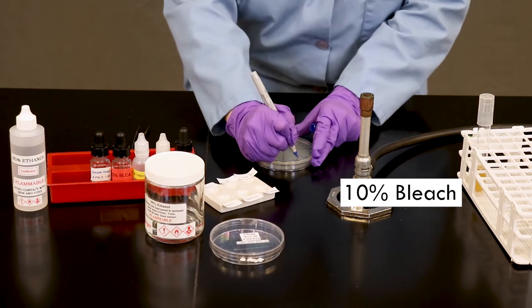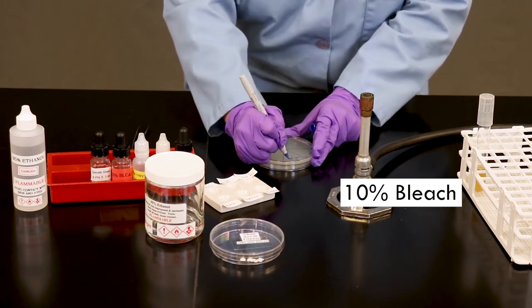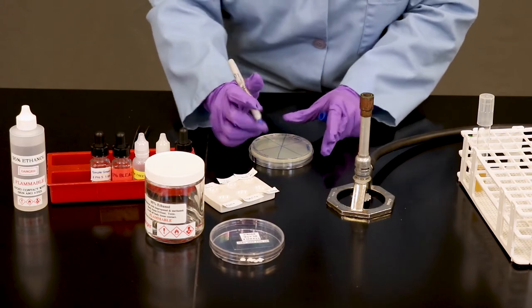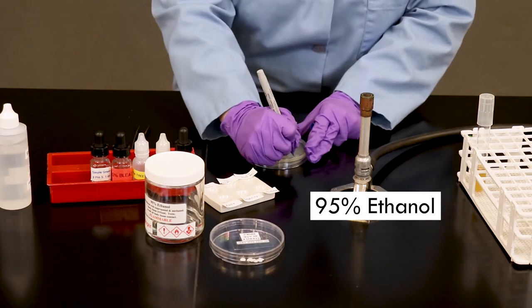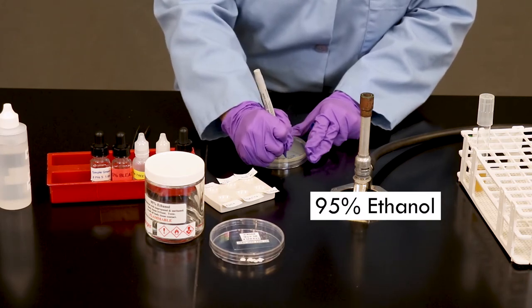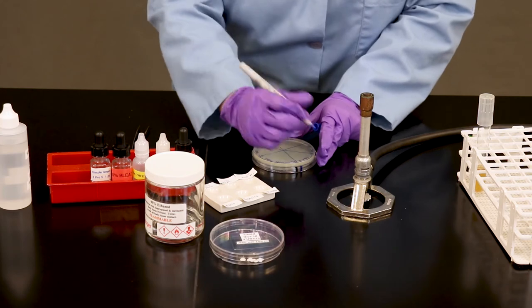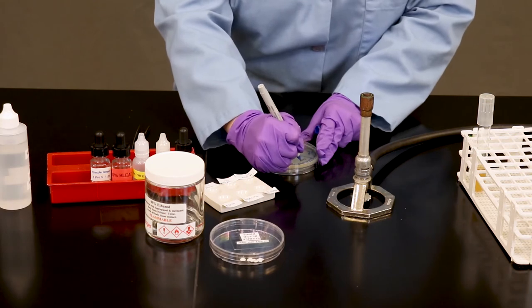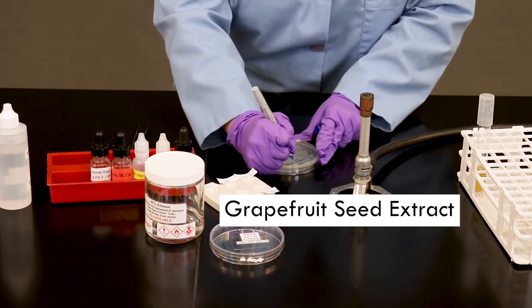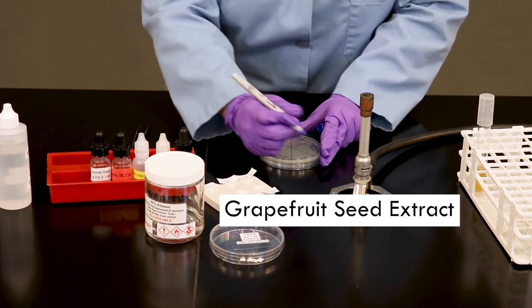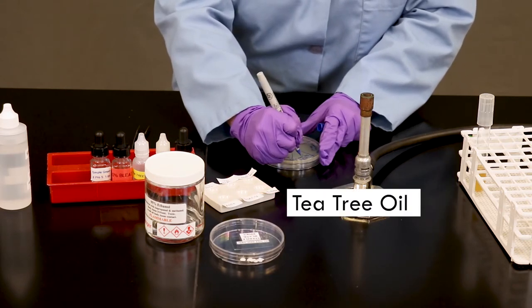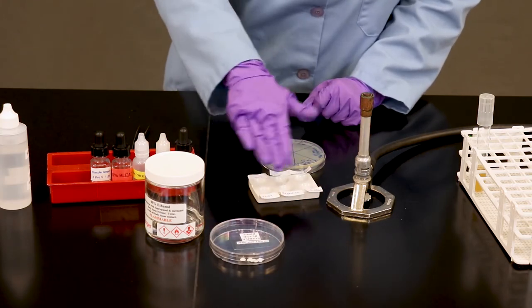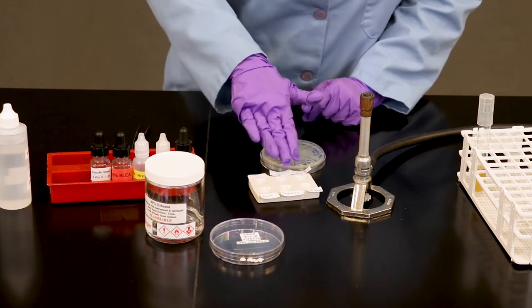We're going to work with 10% bleach, Betadine, 95% ethanol, Simple Green, grapefruit seed oil, and tea tree oil.